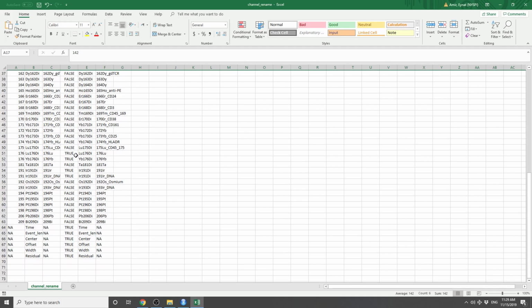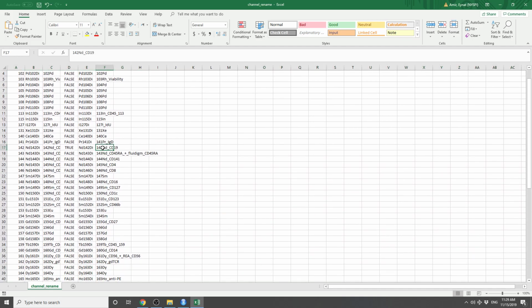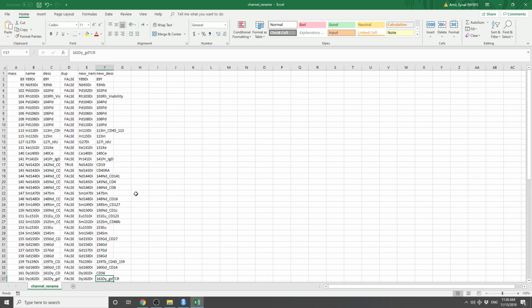And then scrolling down, there's a few other rows that I don't really care about. So let's delete these as well. And now let's say, for example, that I would like to delete the prefix from the channel descriptions. So the mass, we have that in the channel name. We don't need to repeat it in the channel description. So I can delete it like so. And let's say that for this channel, I just want to call it CD45RA instead of this long string. And let's say that we want to call this channel just CD56. And anything else I want to do here? Just for good measure, let's delete a few more of these. So I'm done editing the spreadsheet, and I can save it.